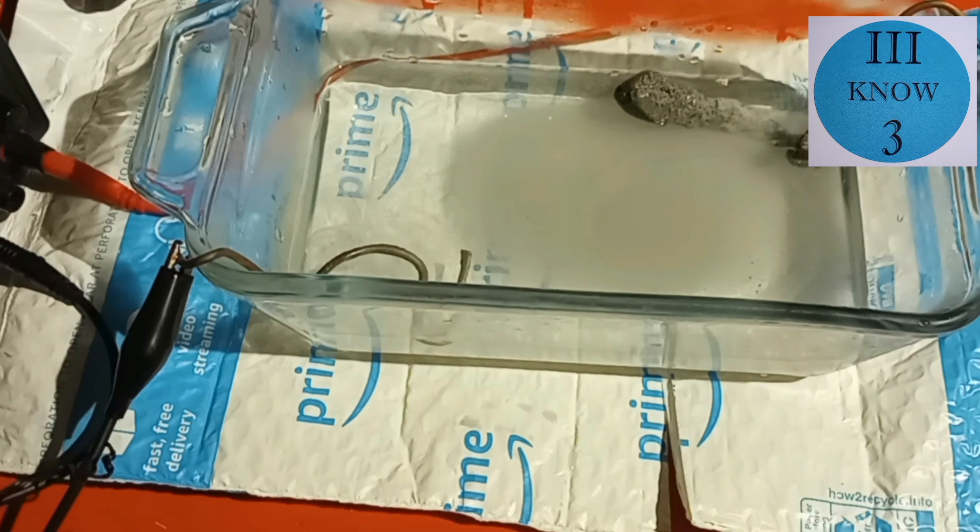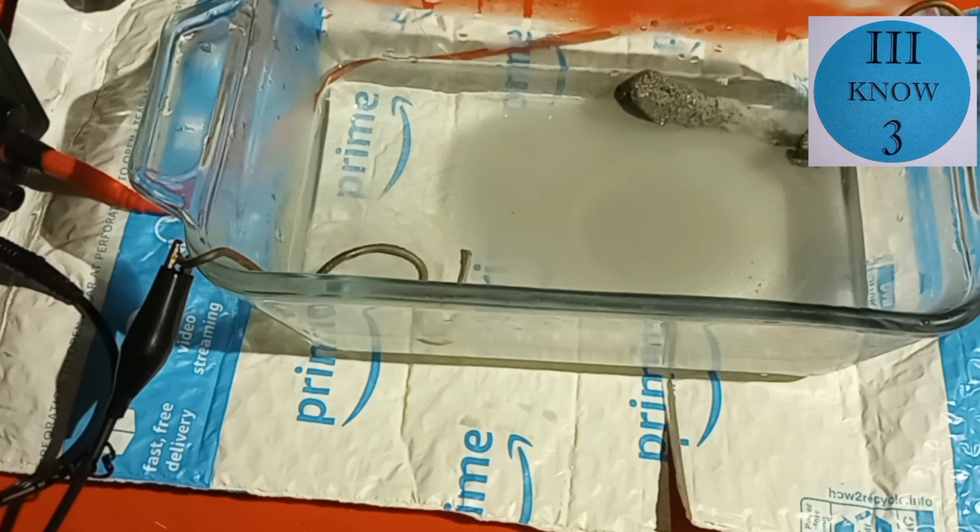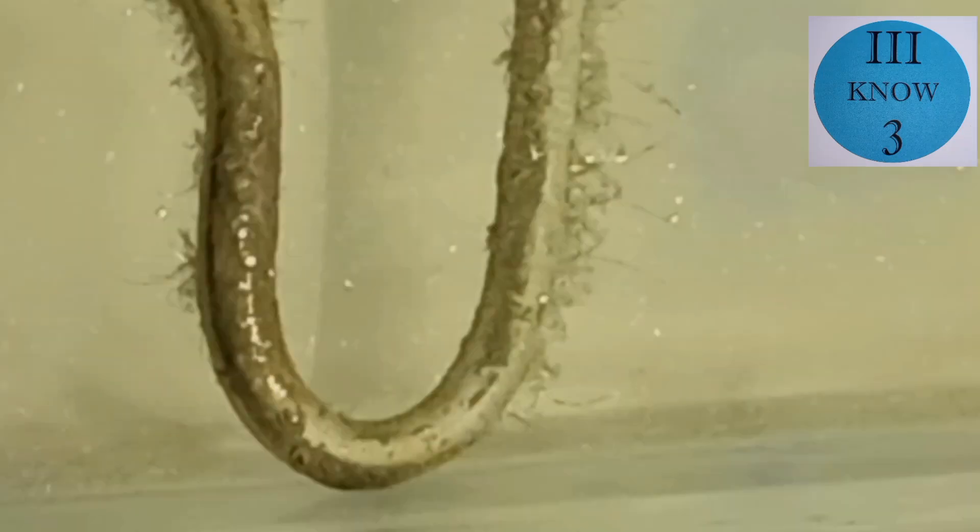I'm going to continue to work with this tin, and I will probably do more follow-up videos after this one. Here are some close-ups sped up to 64 times normal speed.